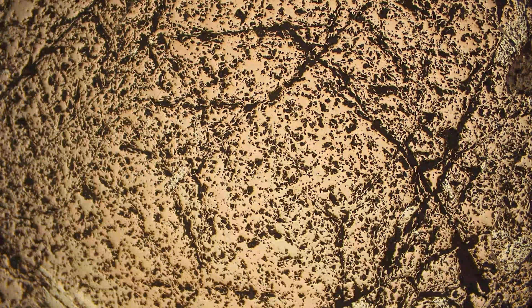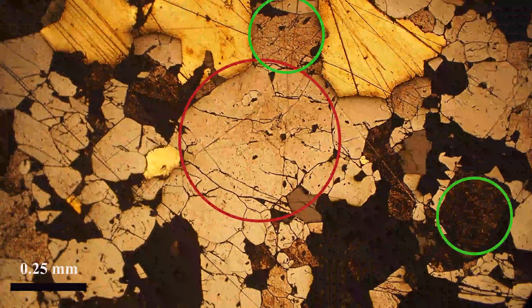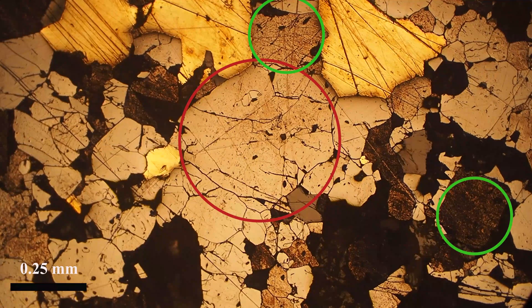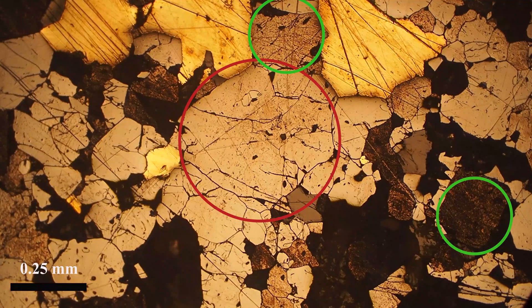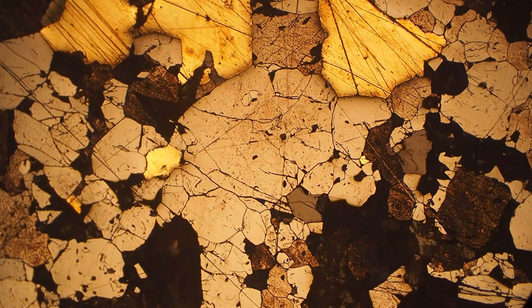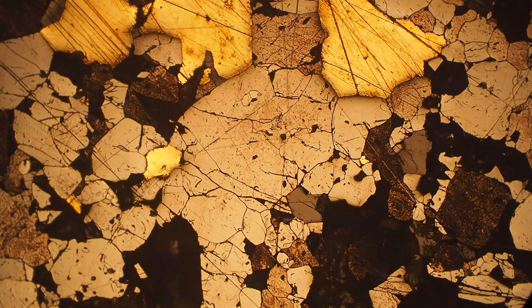So the main things to note: it's not bireflectant, it's isotropic, and it's gray with a brownish tint.